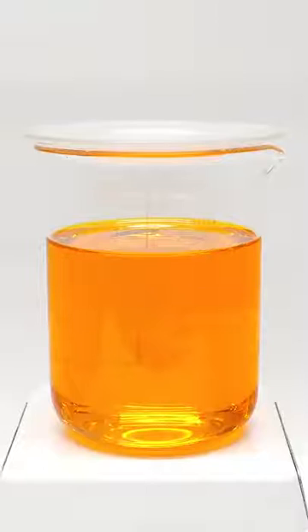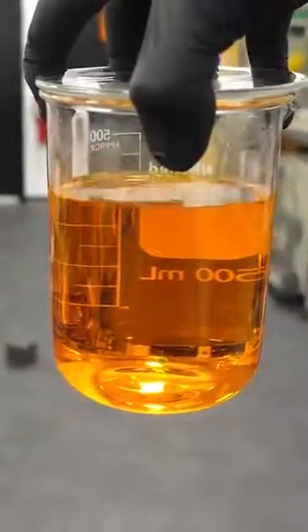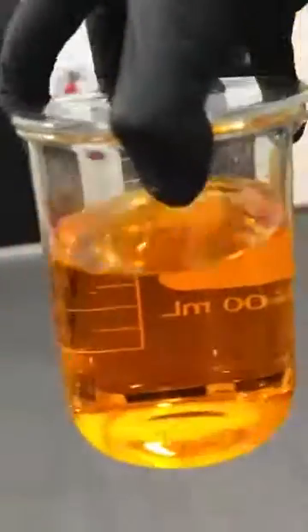I should say, though, that the gold hasn't actually vanished, and it's just in a water-soluble form called chloroauric acid. It's actually very easy to get the gold back, and I'll show you how to do that in another... Oh, no.